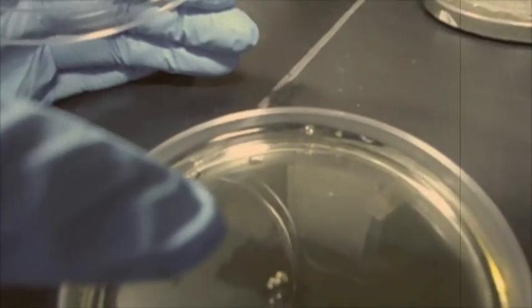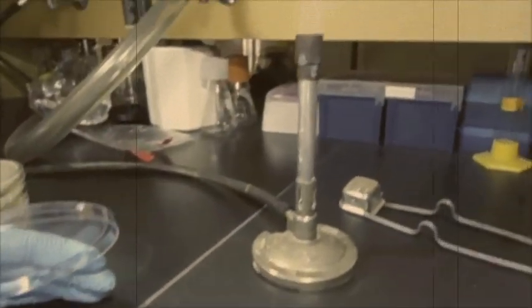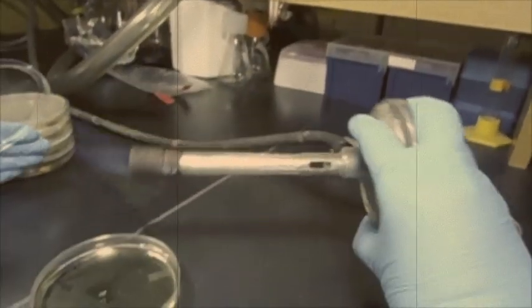If there are any air bubbles on your plate, quickly lift lid again and use flame from Bunsen burner to pop them.